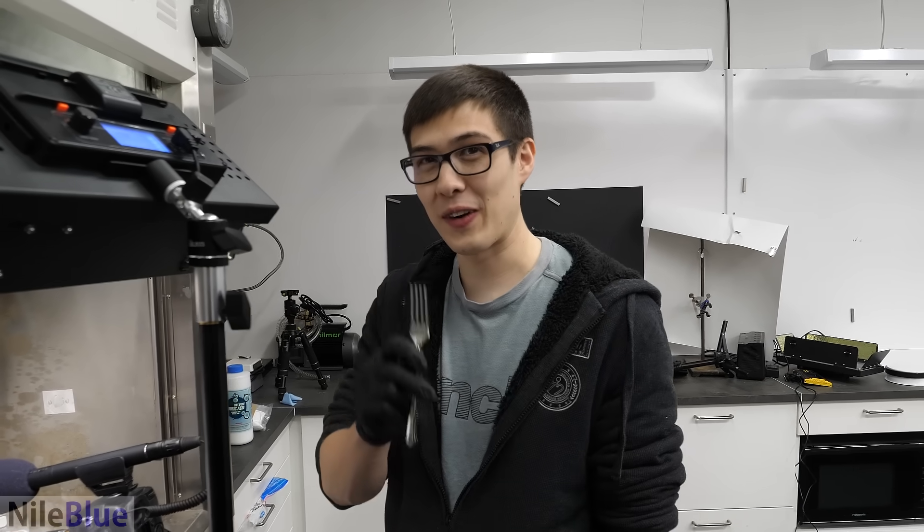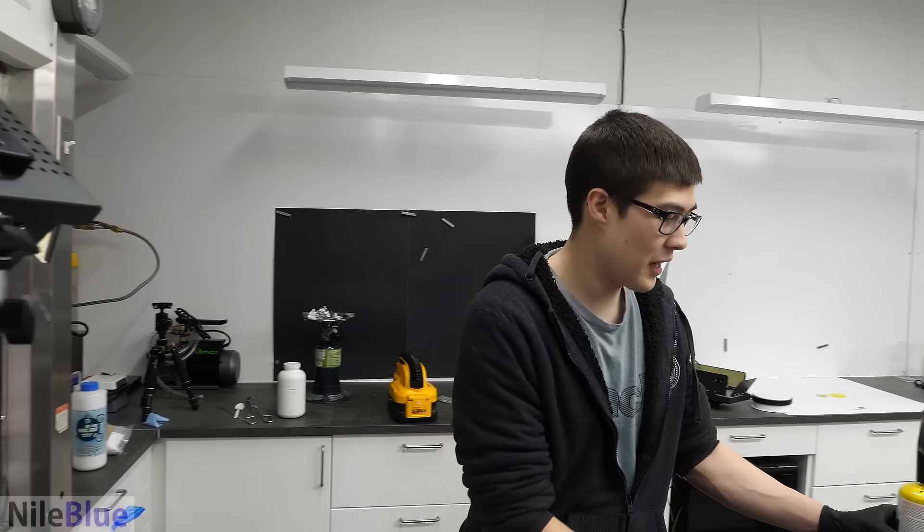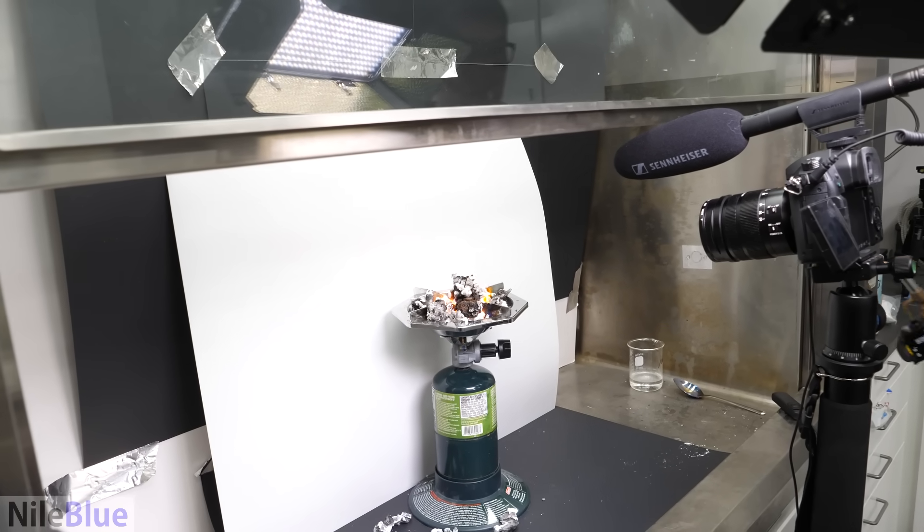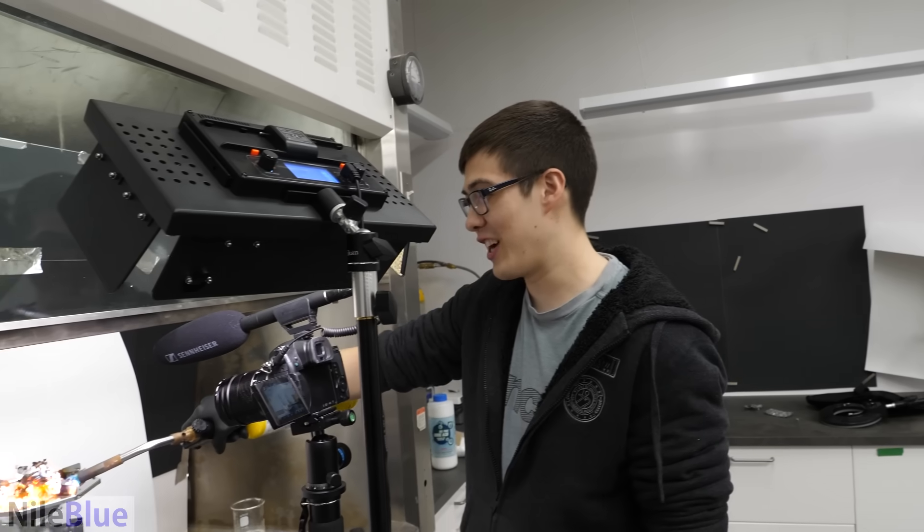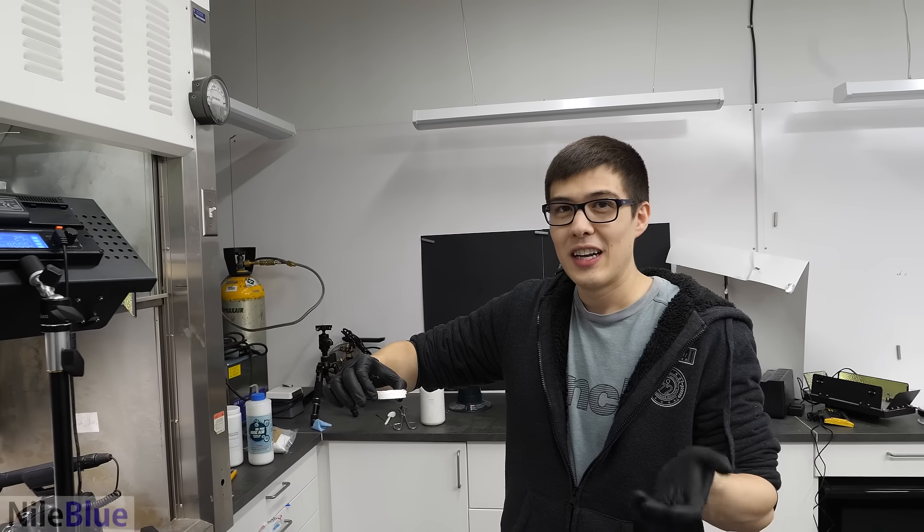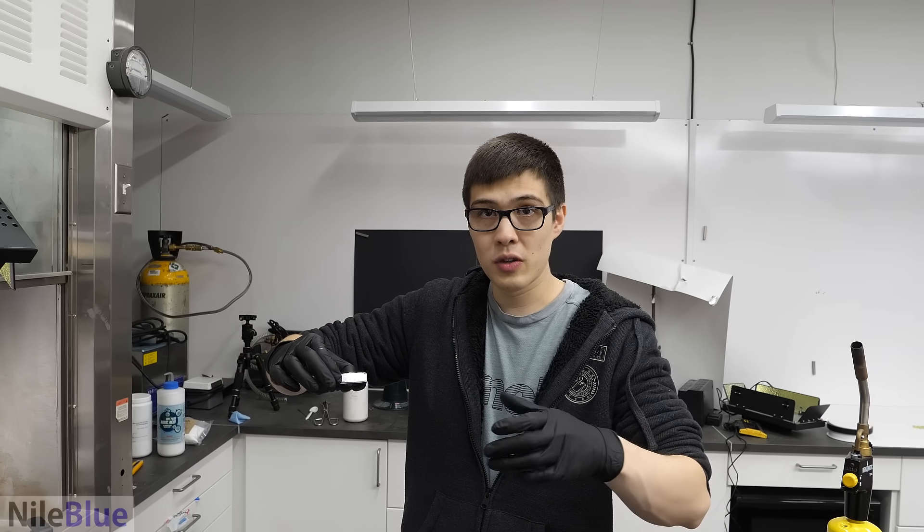We have to shoot it with a blow torch. We have literally no other option. It's like the more fire we shoot at it, the bigger it gets. The heat from the burner was kind of just coming from the sides. And I thought that maybe a hot, a really hot, hot plate would give more uniform heat from the bottom.